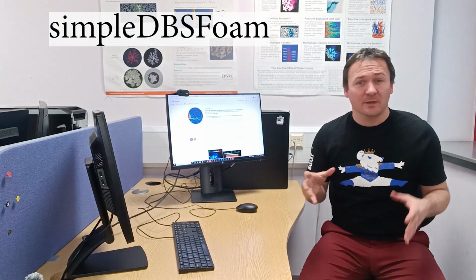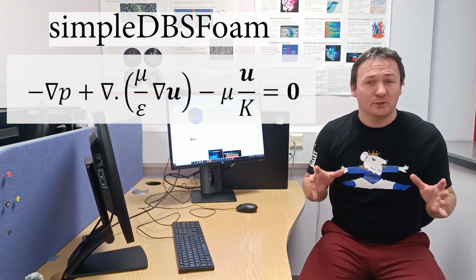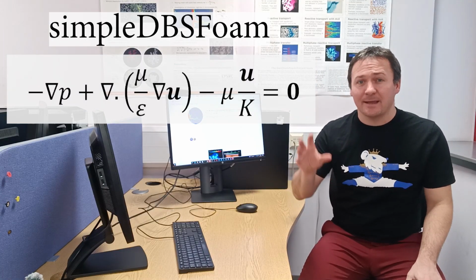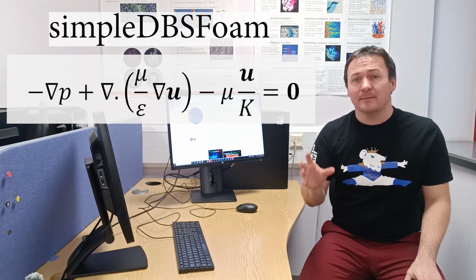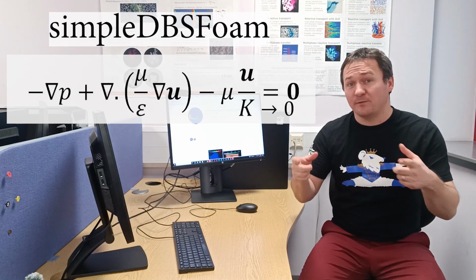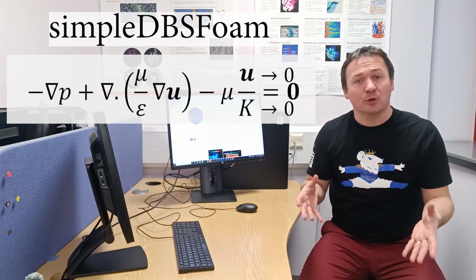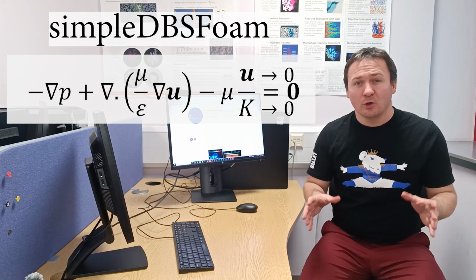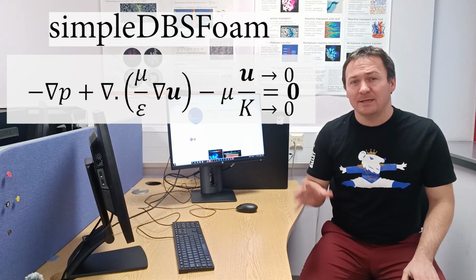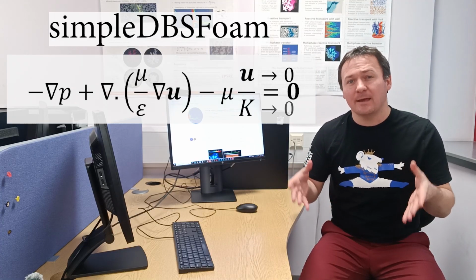For this demo, we're going to use the GeoChemFoam solver simpleDBSFoam. This solver is based on the Darcy, Brinkman, Stokes equation. The nice thing about this approach is that we can penalize the solid phase by giving it a very small permeability. This forces the velocity to go to zero in the solid, which basically behaves like a no-slip boundary condition. We'll go into the detail of the implementation in a separate video. Today, the goal is simply to see how to use it in practice.